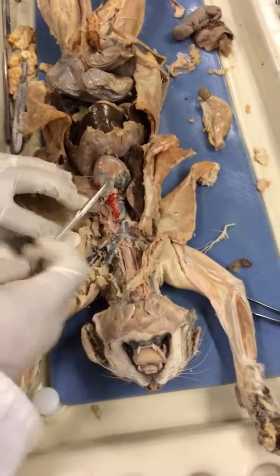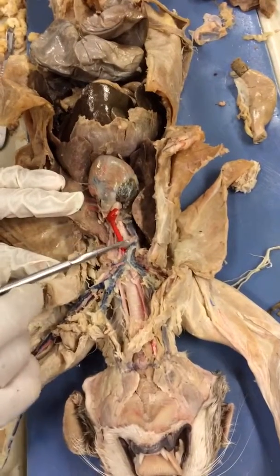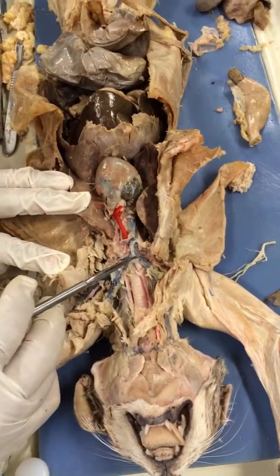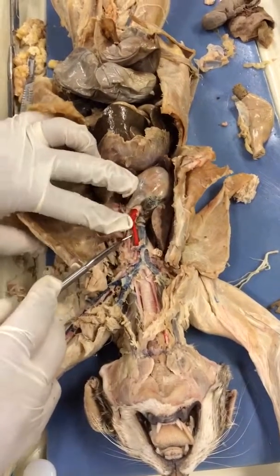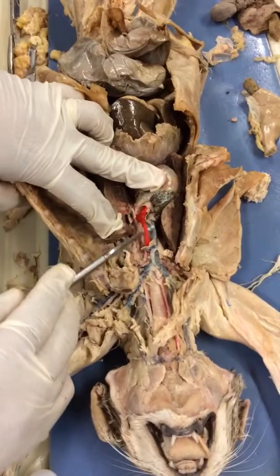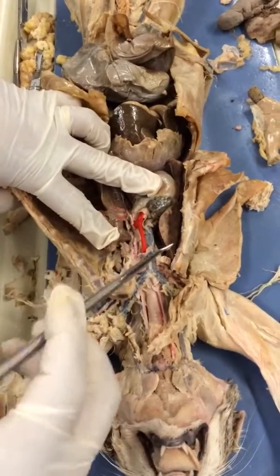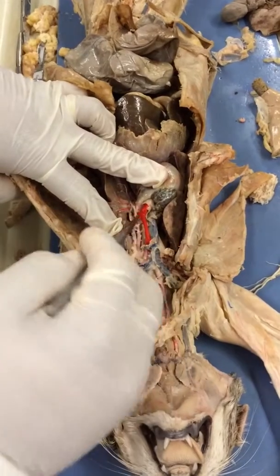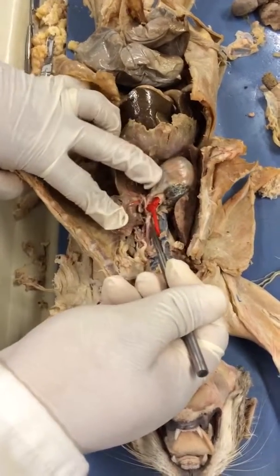All right. So what would this vessel be here? Superior vena cava. The V-shaped structure of these vessels there? Brachiocephalic. What about this first vessel on the right-hand side of the aortic arch? Brachiocephalic artery. The artery coming off of the aortic arch on the left-hand side?